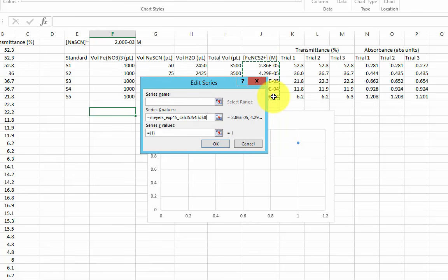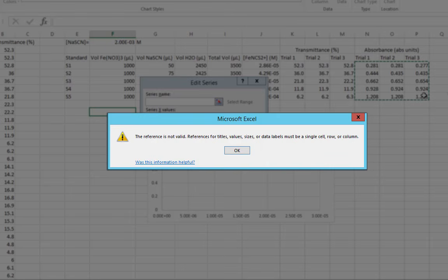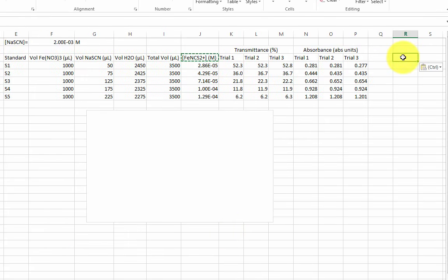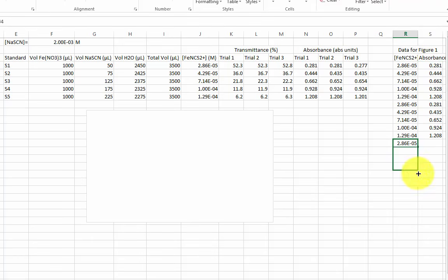Notice the error I get as I add the data as it is organized in this table. There are a few ways to get around this. I'll show you one. In this case, I will combine the data from all 3 trials into a single column for concentration and a single column for absorbance. Notice that I am referencing the cells instead of copying and pasting. This will help my grader know where I got these values.